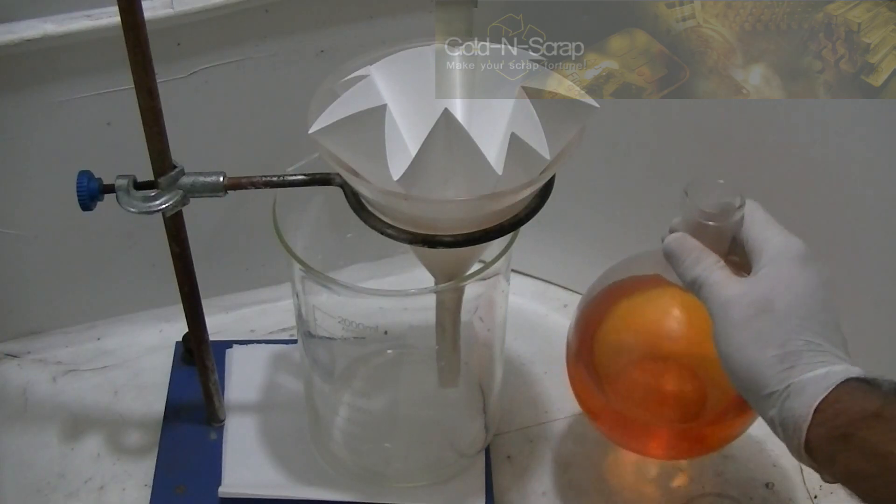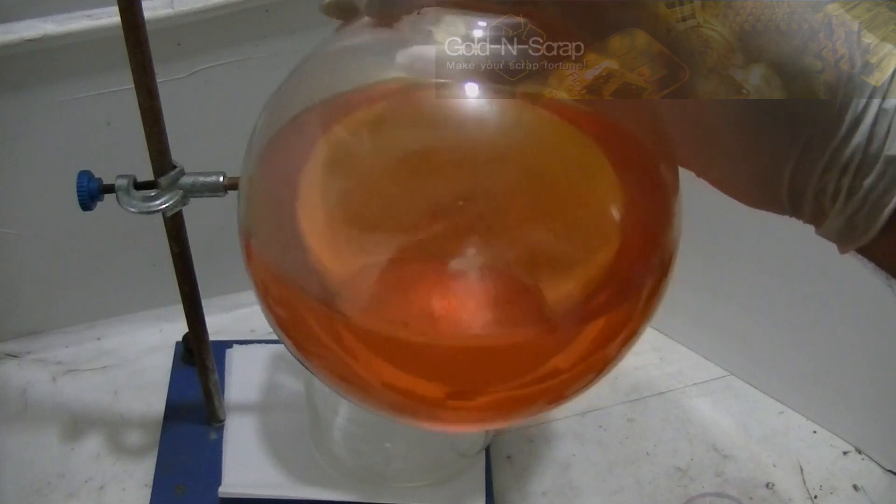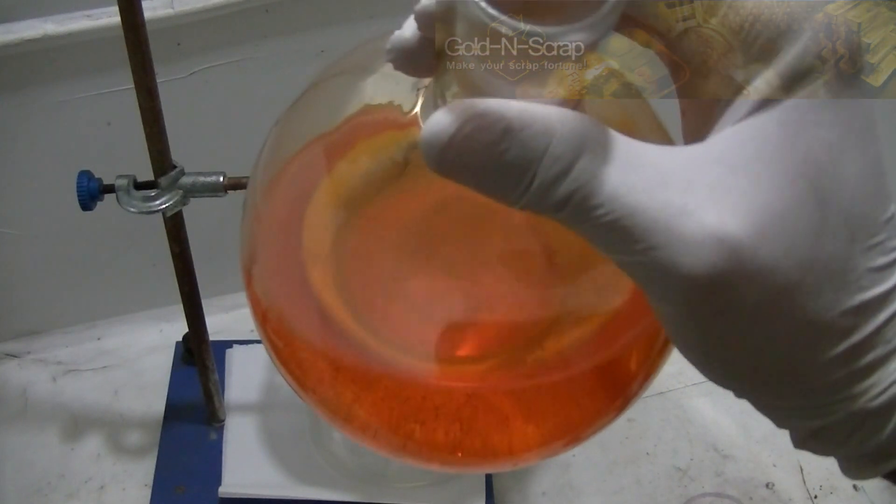On the following day, all the junk is in the bottom of the flask and the gold solution is ready to be filtered.